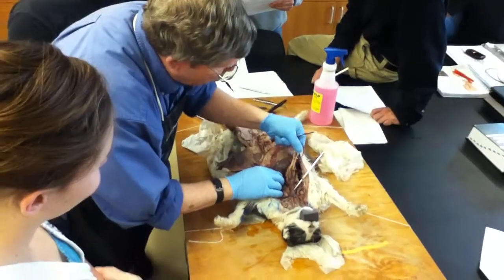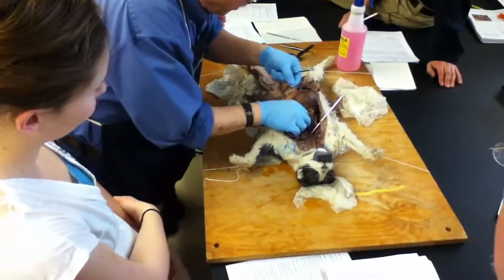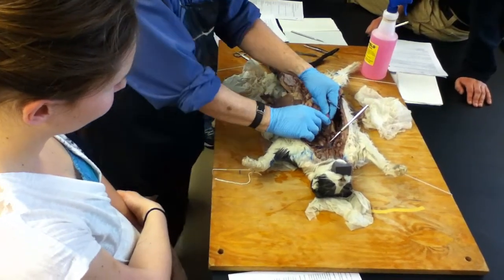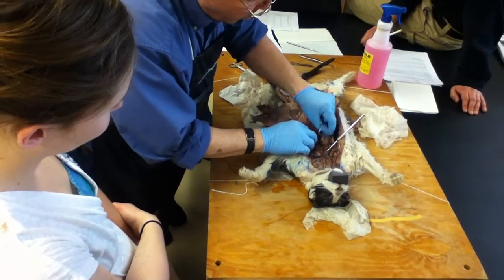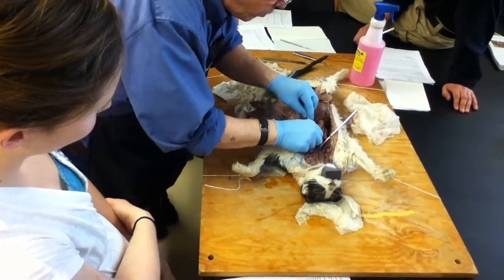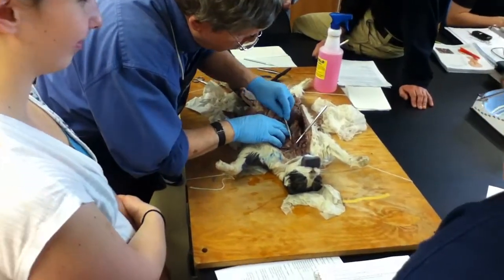So I'm going to now remove part of this thymus and some of the fatty material, since both groups have seen this. And as we do that, you say, aha, look, there's another sac over there. Oh, cool. Okay, so basically, and this is not uncommon in humans as well, you get fat deposition on the outside. And so here you can see the underlying pericardial sac. And so now, just move some of this out of the way. Extra stuff here.